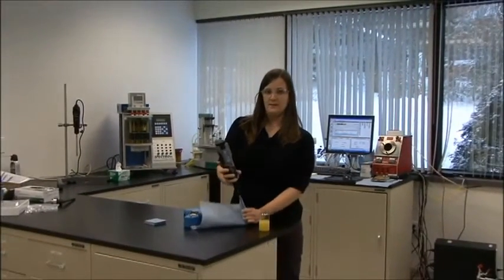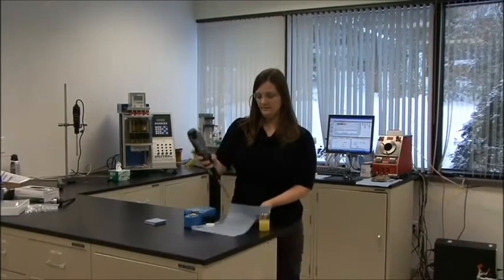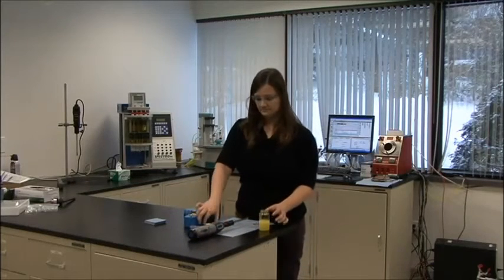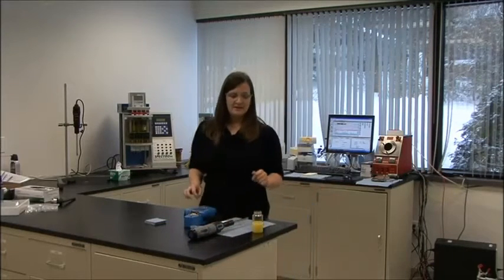Once I'm done, I'm just going to wipe the tip of my homogenizer with a towel and let my sample rest.